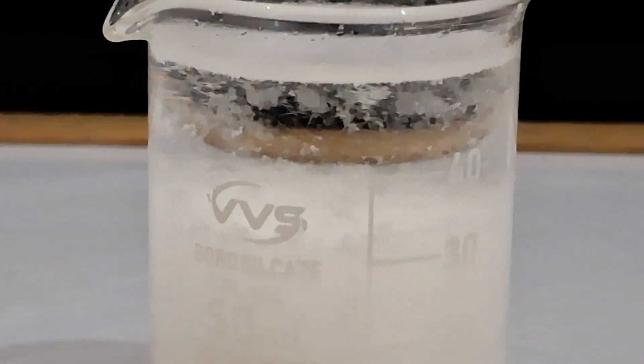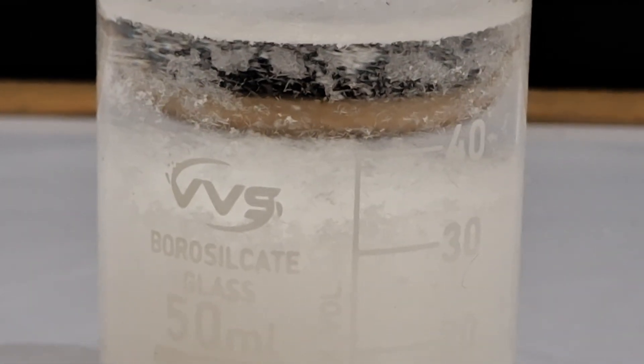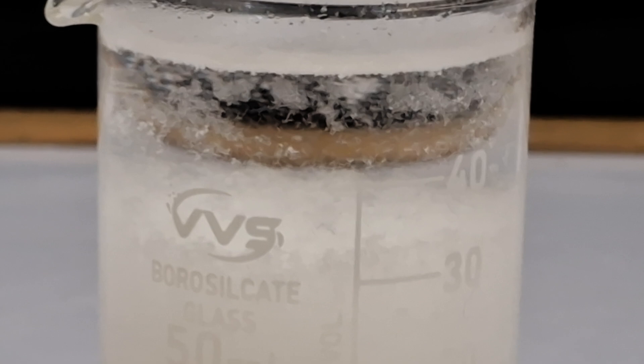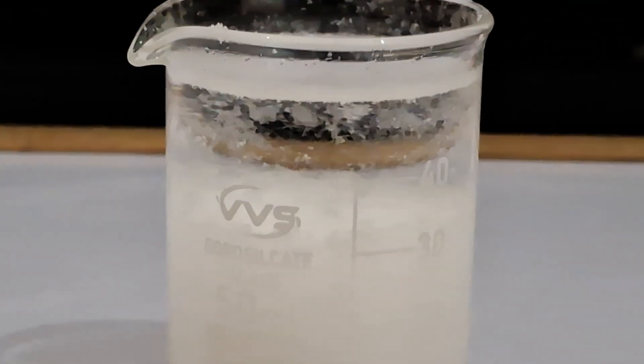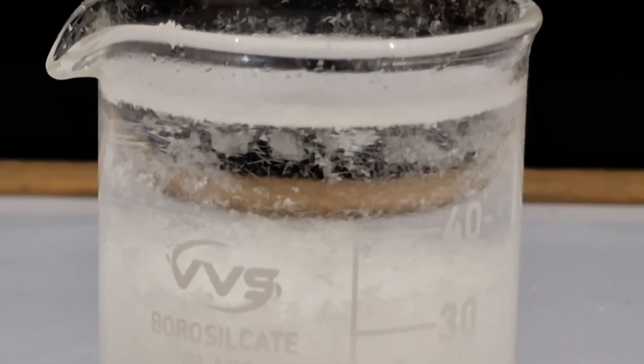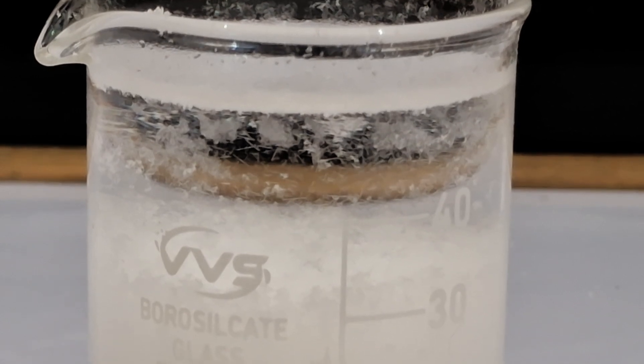After the solution has cooled down, tiny needle-like crystals of benzoic acid have formed. This recrystallization was done majorly to remove any impurities that may remain in the benzoic acid.